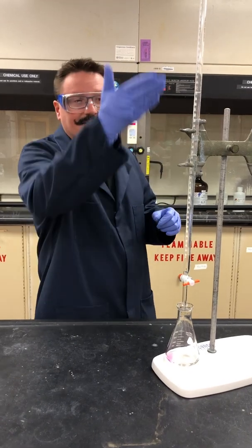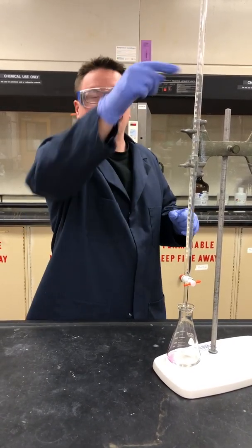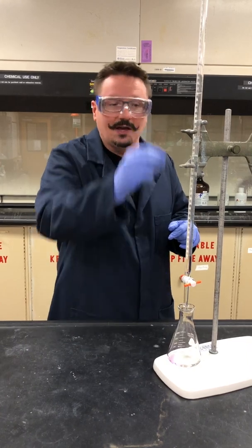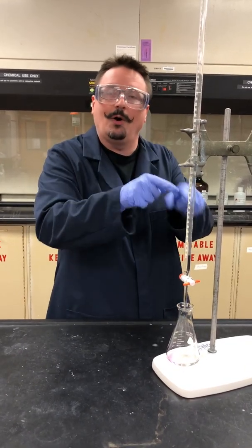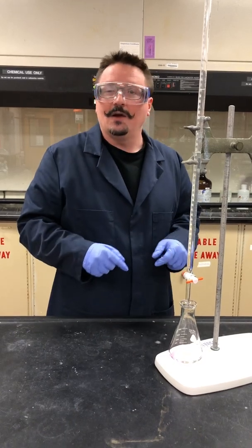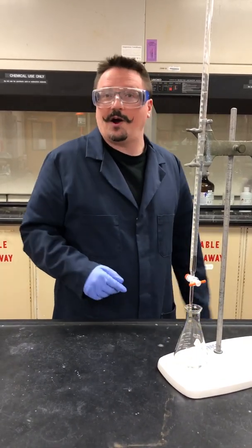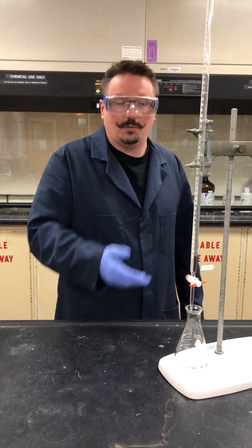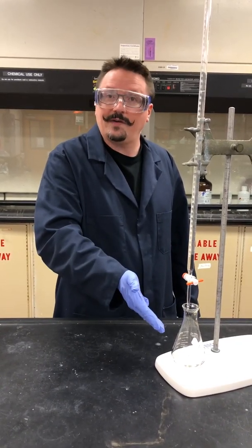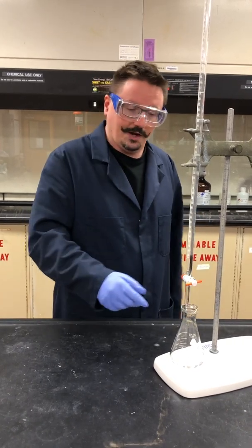And so because of that — because I know the concentration of the sodium hydroxide and because the burette is going to let me determine exactly how much we've added — we can figure out exactly how many moles of that titrant, that sodium hydroxide, we've added. And if we know the volume of our acid, we'll be able to determine how many moles of acid are in here. Once we know the moles of acid and we know the volume, we also know the molarity.